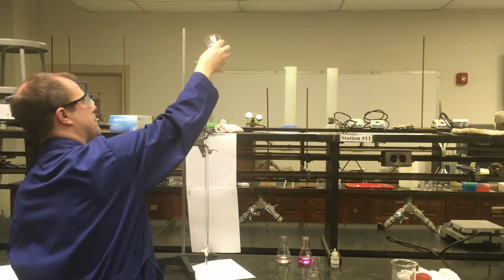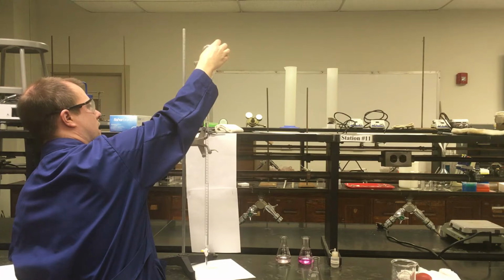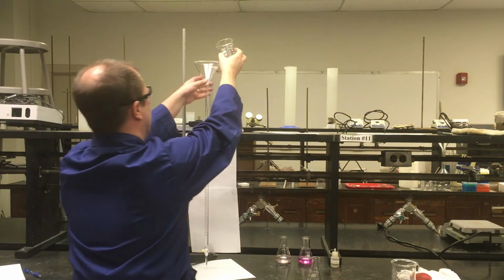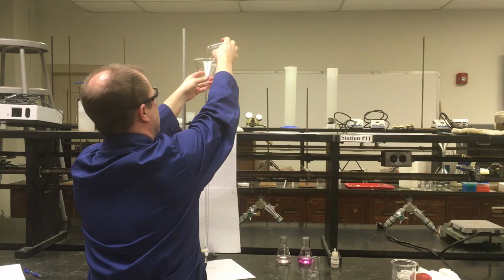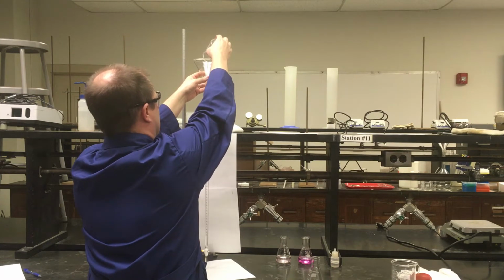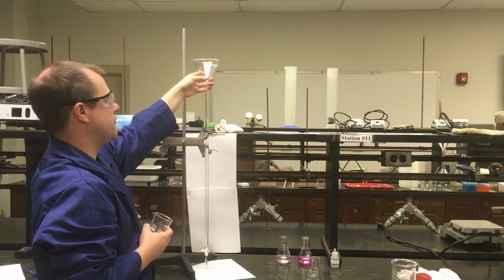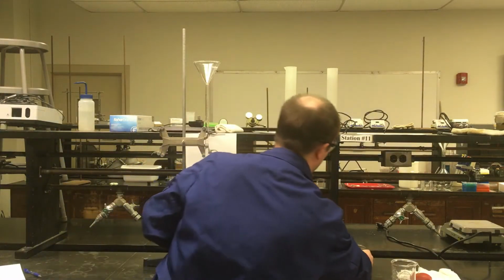And so I'm going to add my sodium hydroxide, and I just want to be careful not to fill the sodium hydroxide level so high that I can no longer measure its volume. Right, that's the biggest thing I want to look out for. I probably want to keep a little bit of space there so the funnel drains. What I did there is I basically just lift it up slightly on the funnel, because if I let it sit there, it can actually make a seal and the funnel doesn't drain very well, so that's what I was doing there.